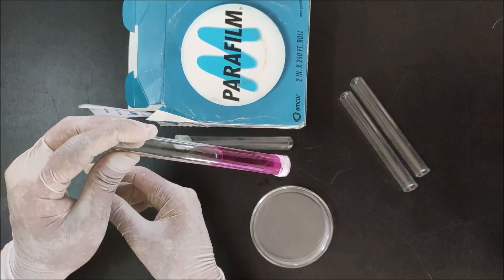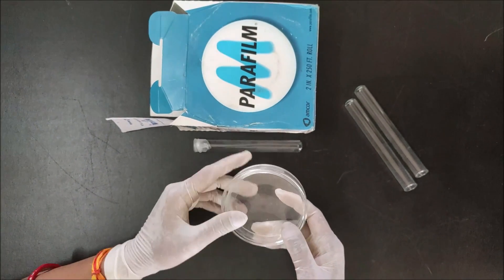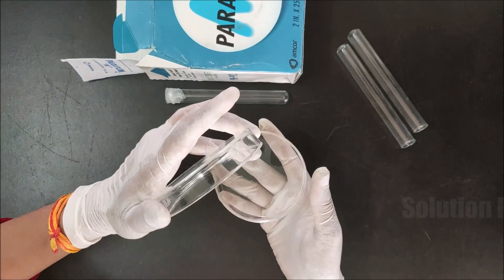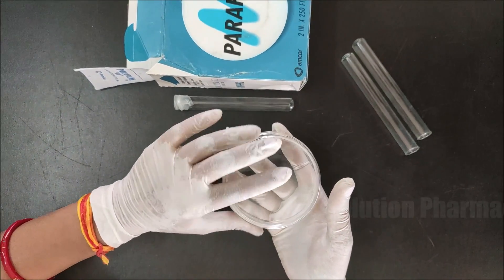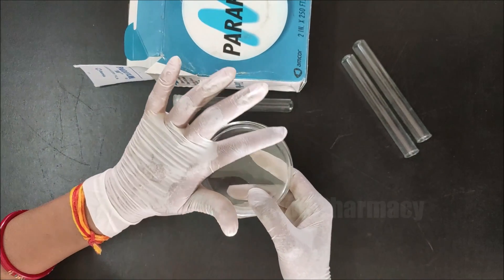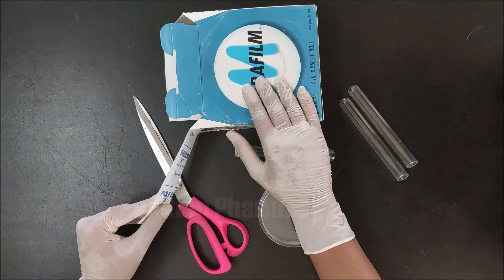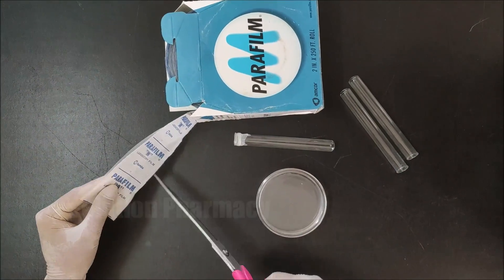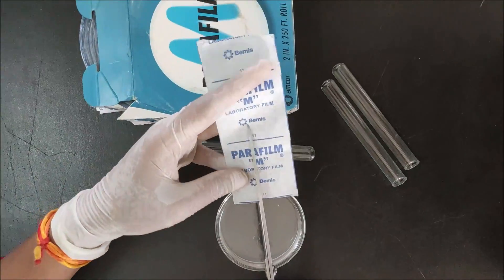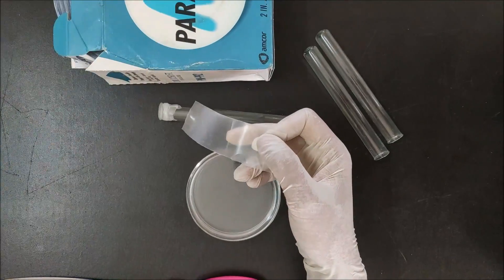Next I will show you how to seal a petri dish with parafilm. Suppose you have prepared agar media in this petri dish. Cover the petri dish with the lid, and if you want to seal the round edges of the petri dish all around with parafilm, cut the parafilm strip — here we are cutting it half lengthwise — then remove the paper cover.